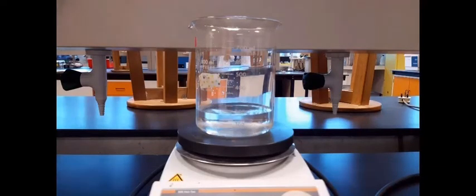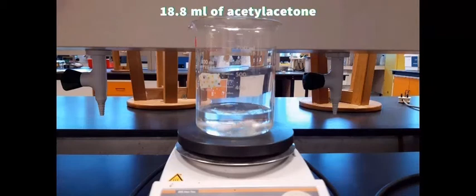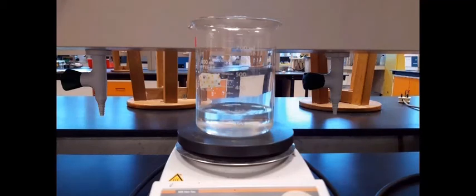For synthesizing manganese 3 acetylacetonate, we need 3.9 gram of manganese chloride tetrahydrate and 10.2 gram of sodium acetate trihydrate. These two chemicals will be mixed together, and after that we'll slowly add 18.8 ml of acetylacetone into the mixture.